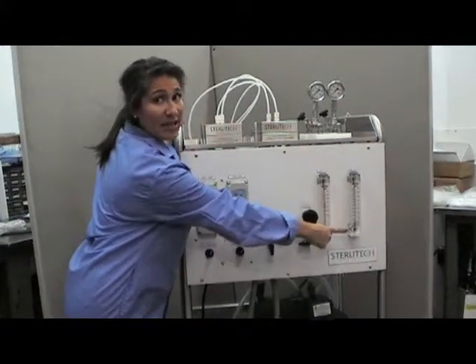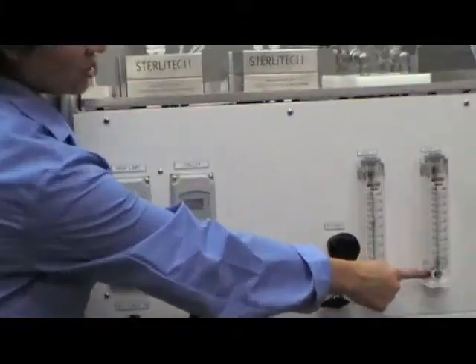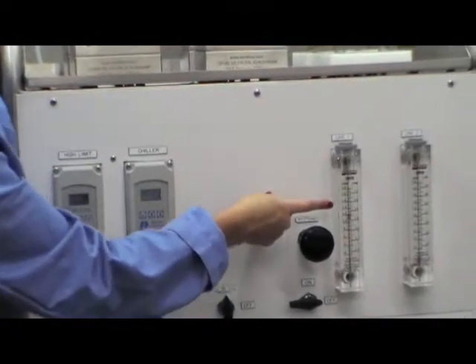Immediately you should see a decrease in the flow coming through line two and an increase in the flow coming through line one.